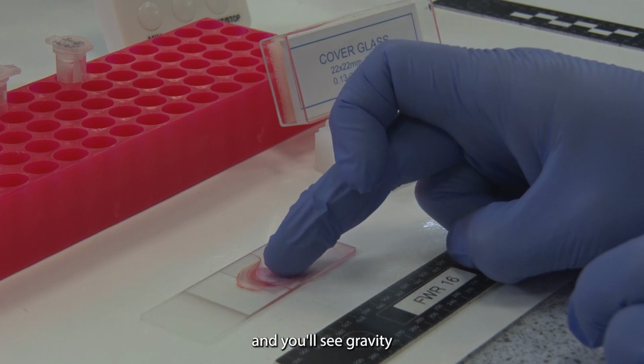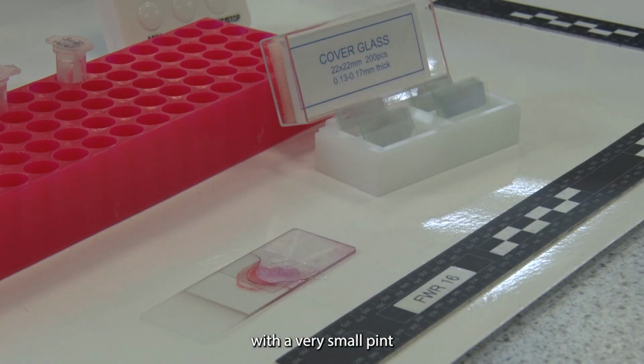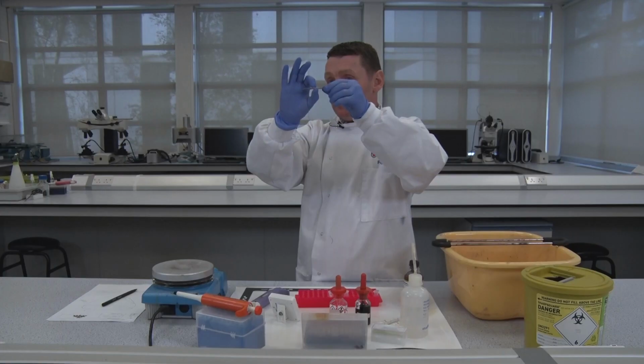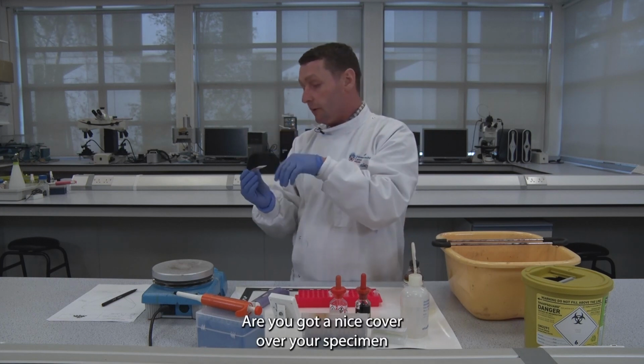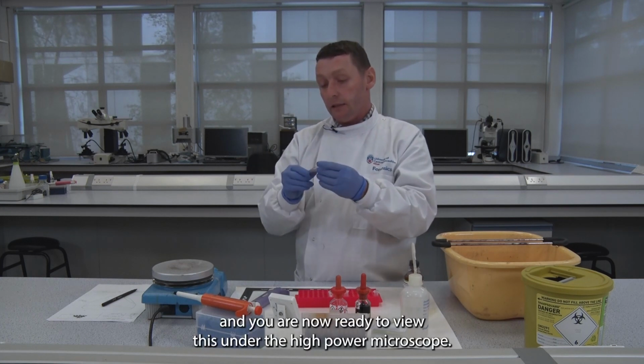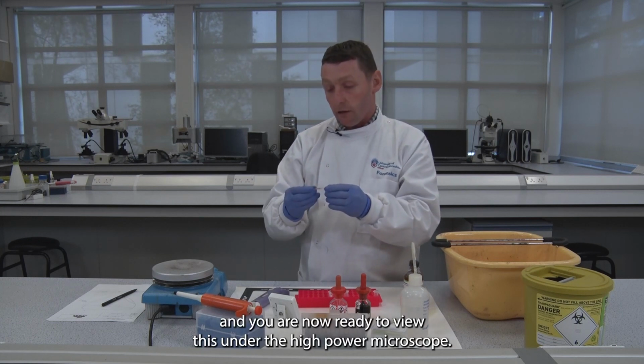And you'll see gravity pushing the cover slip down with a very small pinch. Just squeeze it down, and what happens there, you've got a nice cover over your specimen, and you are now ready to view this under the high power microscope.